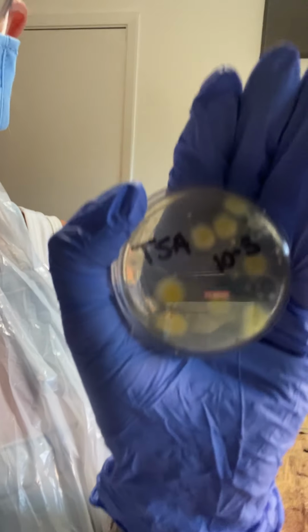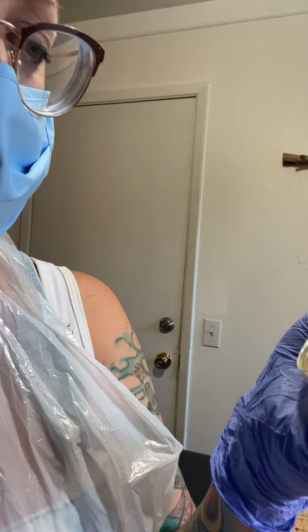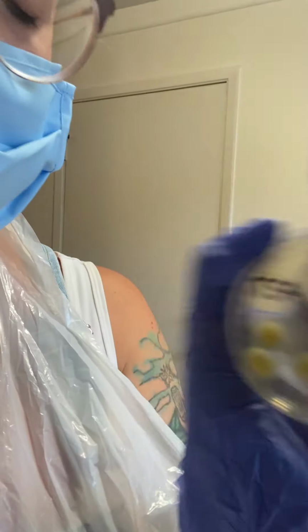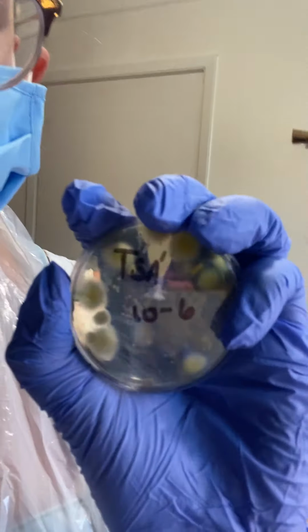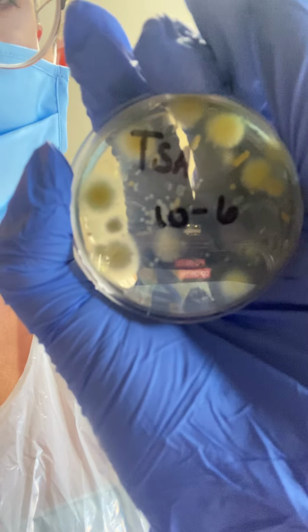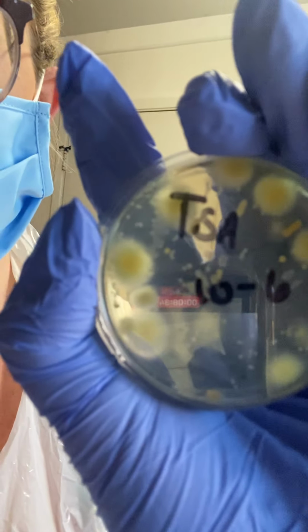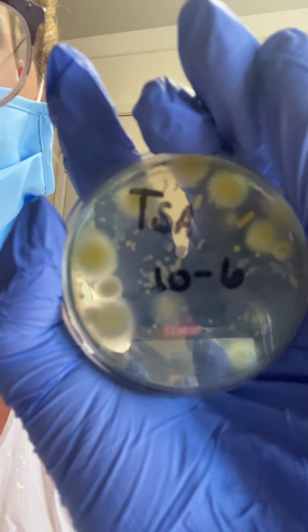If I was able to get a better close-up, I think that you can see around the ridge there are numerous colonies that are over 30 but under 300, which allows me to say that that is an accurate plate. And then last but not least, this is number 6. This also has between 30 and 300. However, along the ridge line, I hope that you can see, there are numerous little tiny colonies, and so I couldn't say that that was accurately under 300.